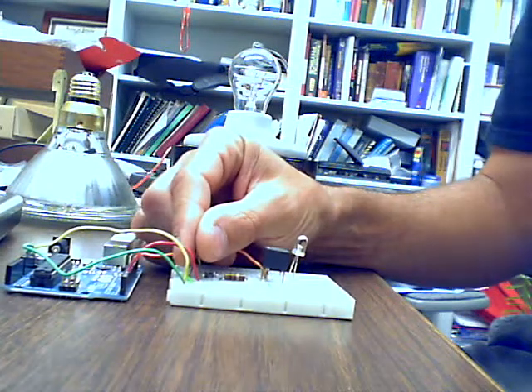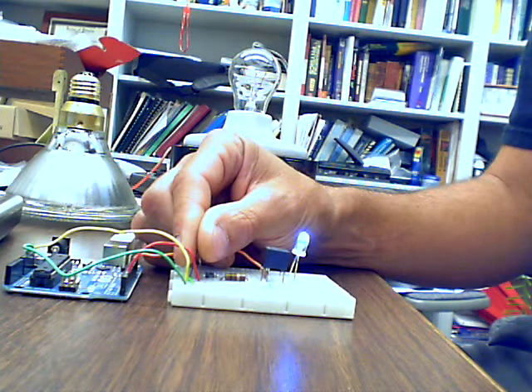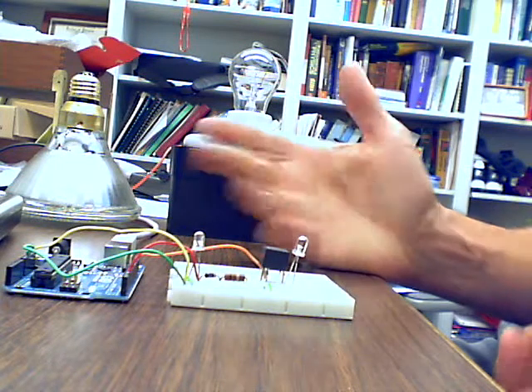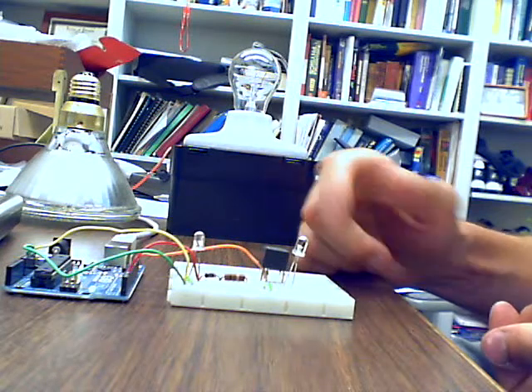If I cover my phototransistor and hit enter, the LED will light up, and when light is sensed, it turns that off. That would be the equivalent of turning the heat lamp off, and it tells me how long it took for the tail to flick out of the way after the light came on.